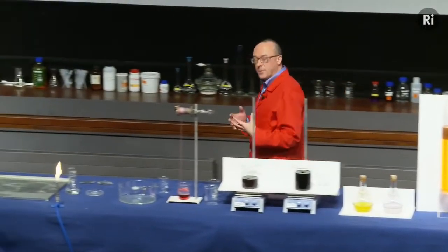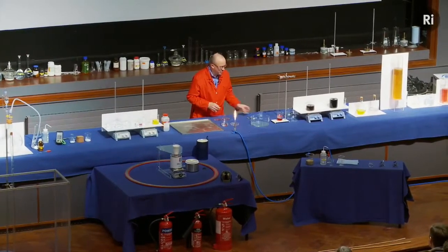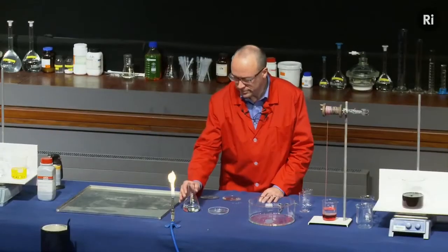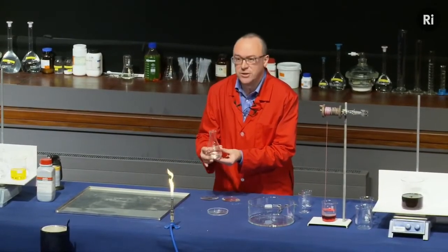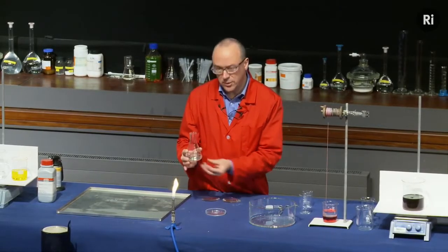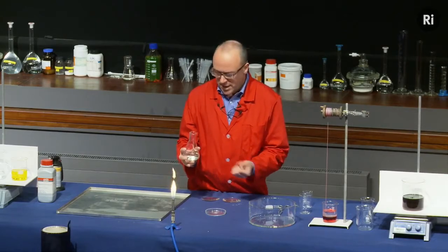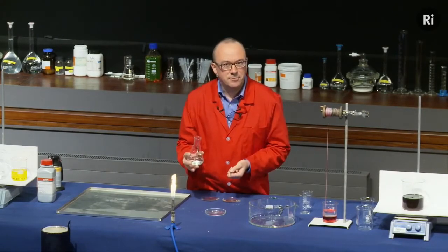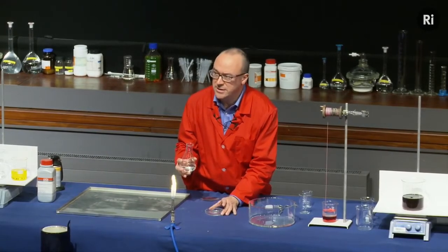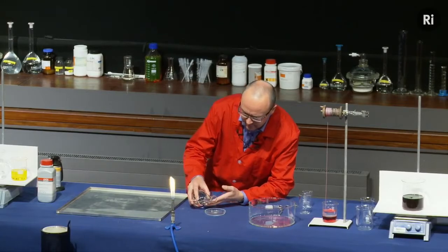Okay, so that's an example of a chemical reaction that produces a change of state. I want to show you another example of a chemical reaction. Again, this is going to go from being a liquid to being a solid. In this flask I have a solution of sodium acetate, and this sodium acetate's a liquid, as you can see, but it would very much like to be a solid. It would like to turn into a crystal. But it needs a sort of an excuse to get going. And the excuse is going to be some little crystals of solid sodium acetate in this dish. So watch what happens as I pour the liquid onto the crystals.